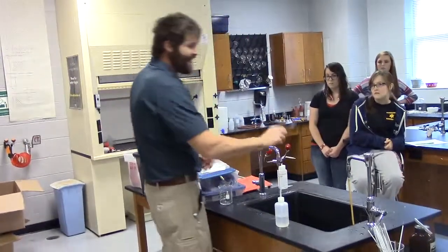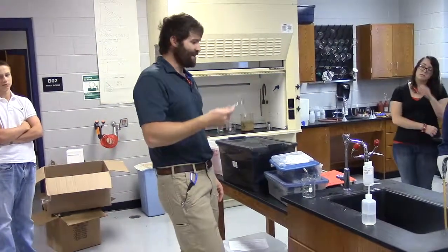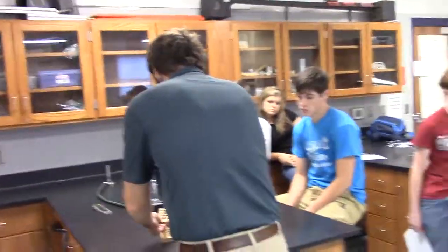And if there's any doubt, I'll give you a little bit of baking soda. You can throw some baking soda in there and neutralize the daylights out of it, all right? And that'll be the end of it. I just had water, so mine's good. I can clean it up, put it back up.